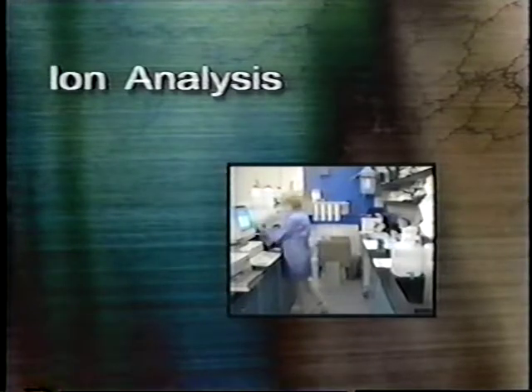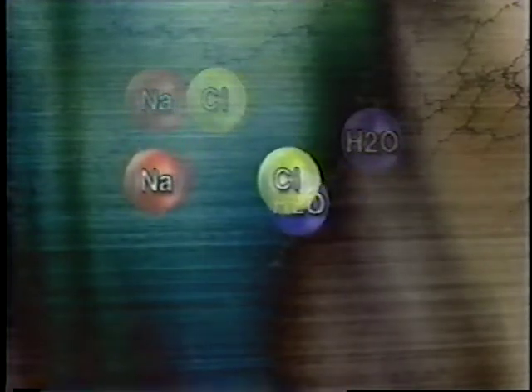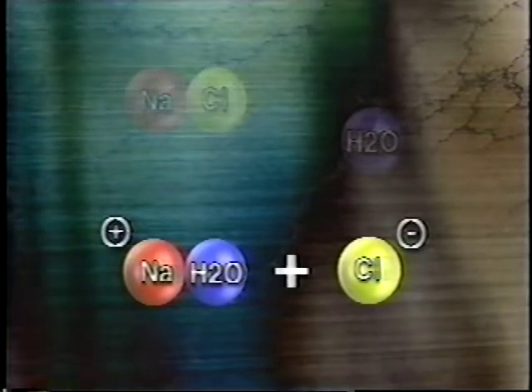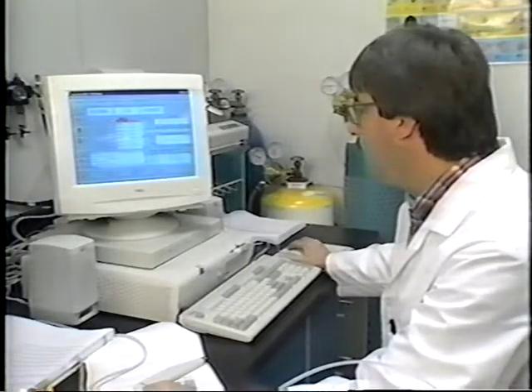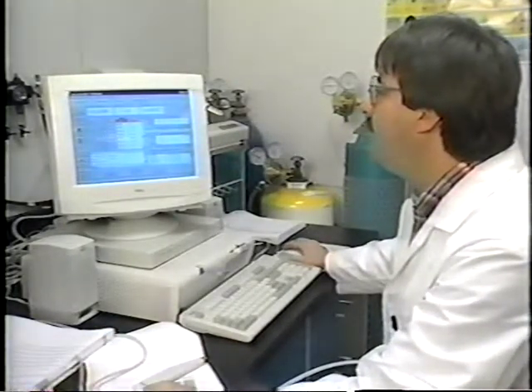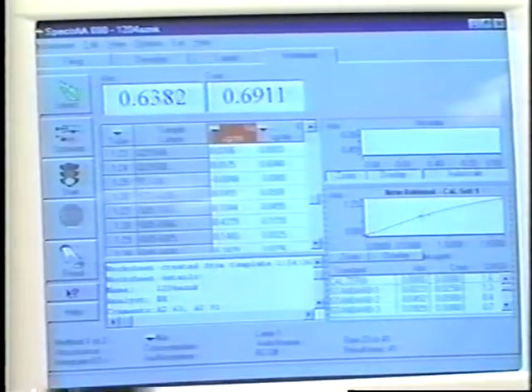The next method we will focus on is ion analysis. Aerosol ions refer to chemical compounds which are soluble in water. The water-soluble portion of suspended particles associates itself with liquid water in the atmosphere, thereby changing the light-scattering properties of these particles. The different ion analysis methods measure, in varying ways, the reflection and absorption of light from sample particulate matter. By noting which wavelengths are absorbed or reflected, technicians can identify which ions comprise a particular sample. Noting the amount of response also allows the technicians to calculate the amount of a given ion as well.